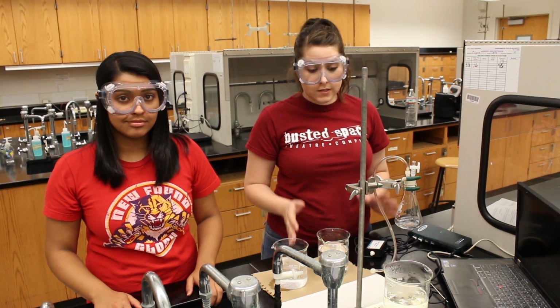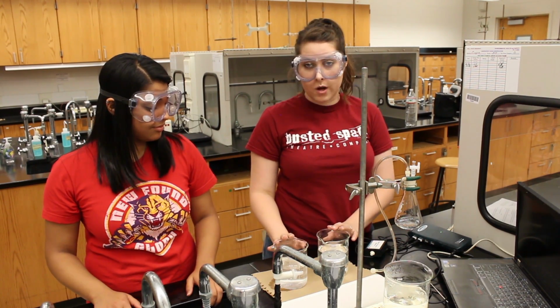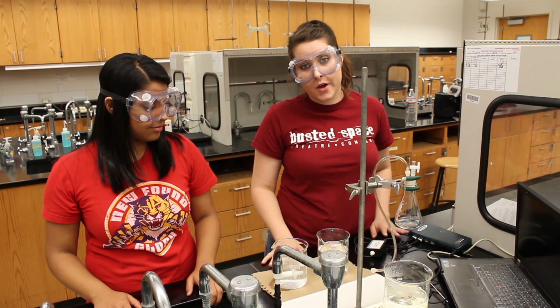Lastly, all that's left is to clean up and take care of all your water baths. And then after that, you should be good to go. Good luck!